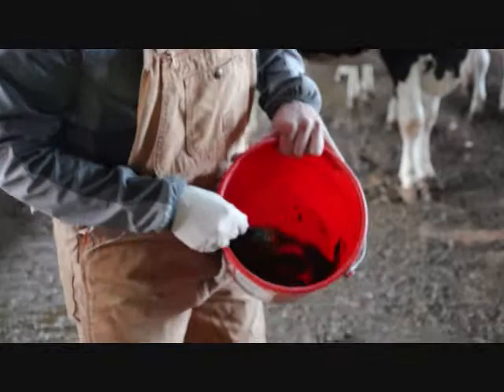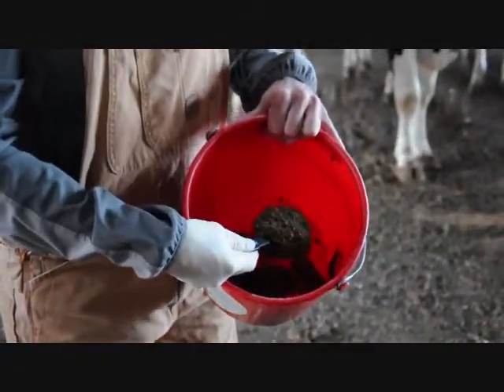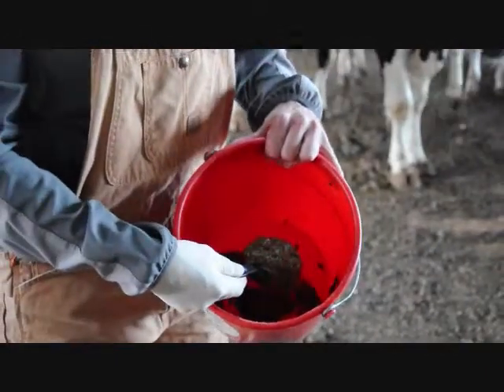When we've got the sample uniform, we'll just go and dump it into the sampling container, which I've got sitting here on the side.